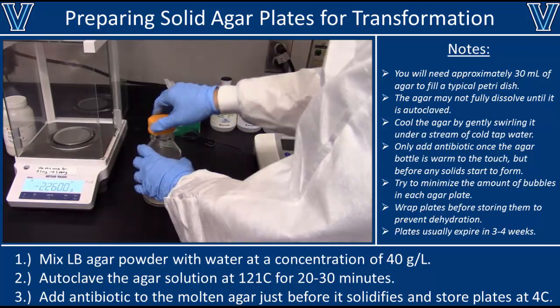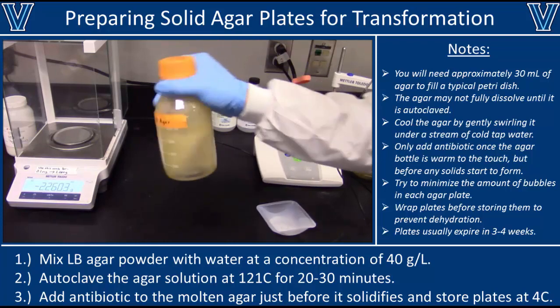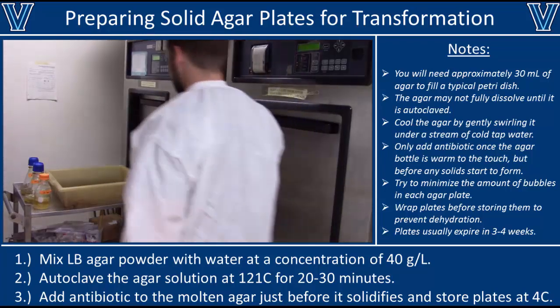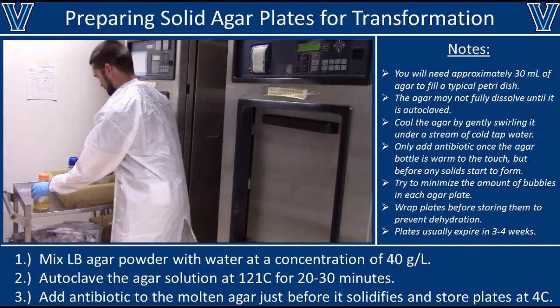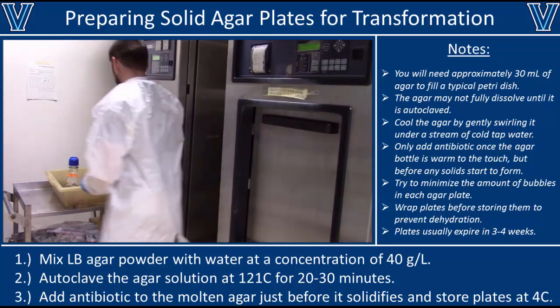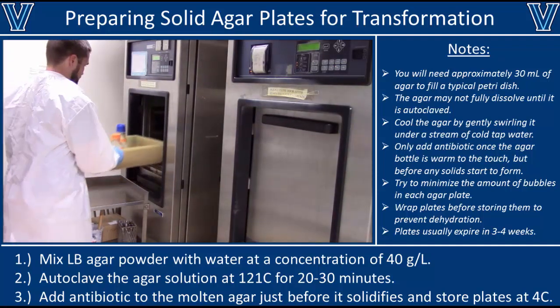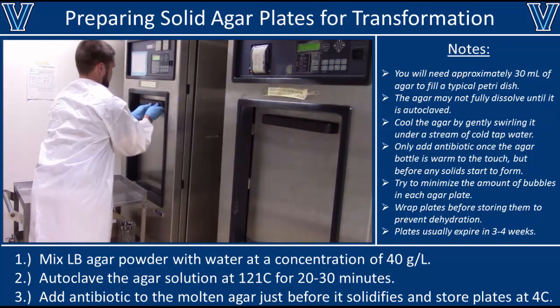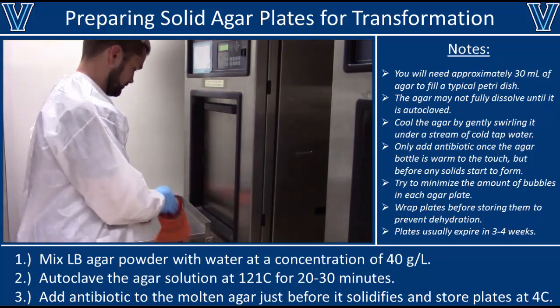Once you have your LB powder weighed out, add it to your water and shake it vigorously. It's okay if you still see some clumps because those are going to dissolve in the autoclave. Your next step is to autoclave your LB agar solution. This will sterilize it, and the large temperature increase inside the autoclave will also initiate the gelling process, just like a batch of jello.